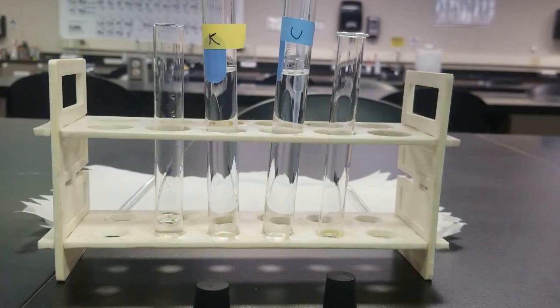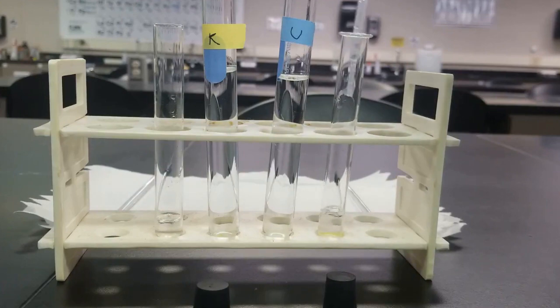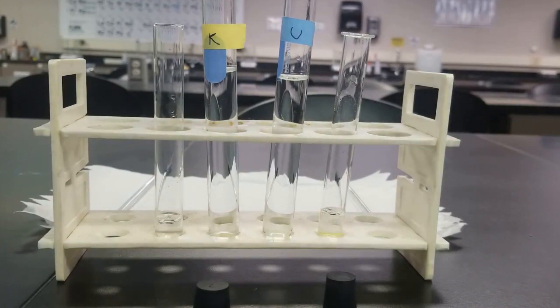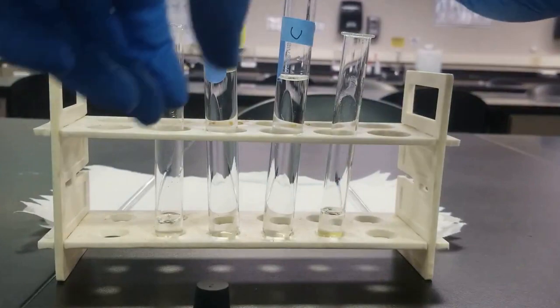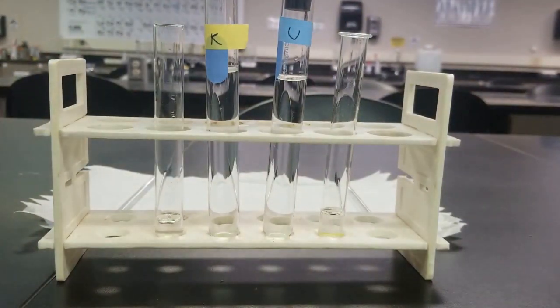Transfer approximately 1 and 1/2, a little over. Oh well. Cool. And we'll move these two over elsewhere, and I'll get some tape for the other one.